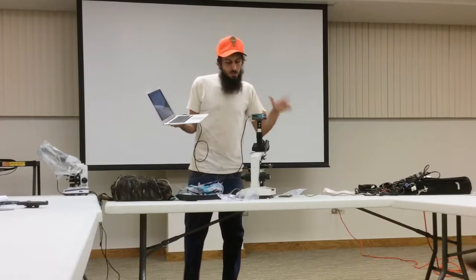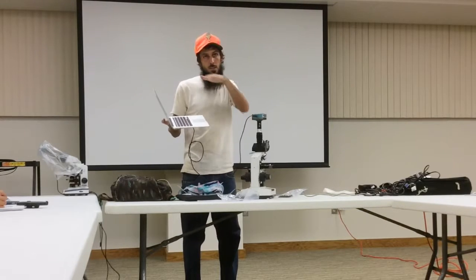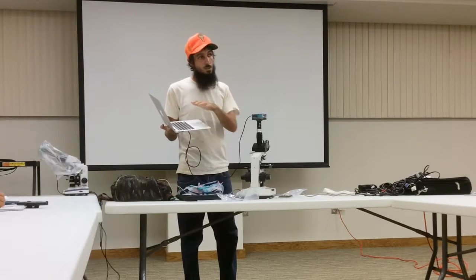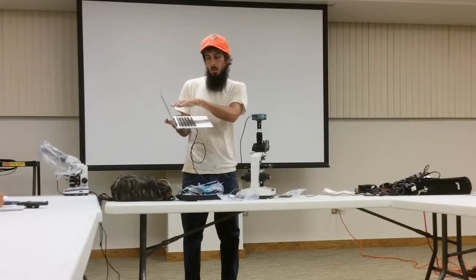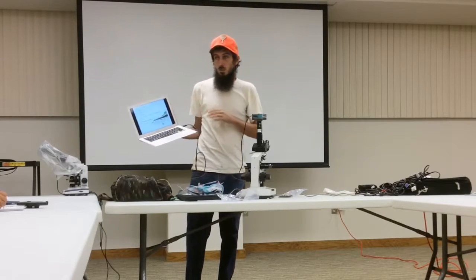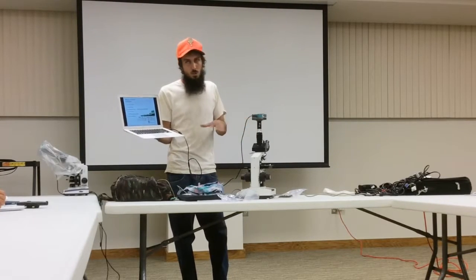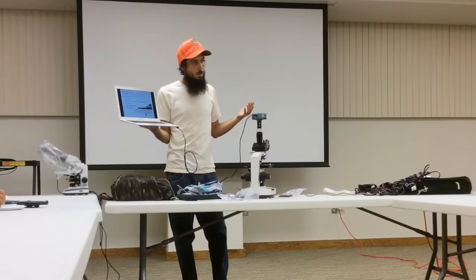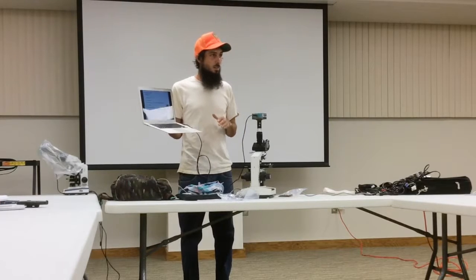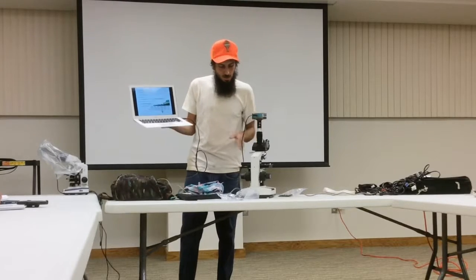So for every slide, I should see one nematode, but for every place I move the microscope and move that slide around, I should see one fungus. So there's a lot of different funguses I should see on this slide for it to be in the balance. And I should also see some active bacteria. A lot of times I look at it and it's all dead and nothing's moving around. But in a healthy soil, I should see some things wiggling around and moving and interacting. So those are the main things I have here.